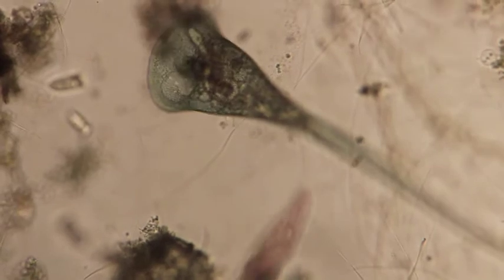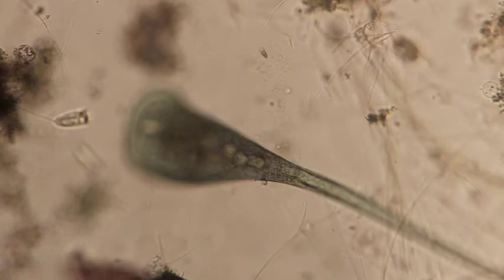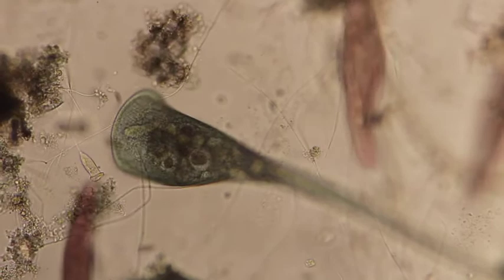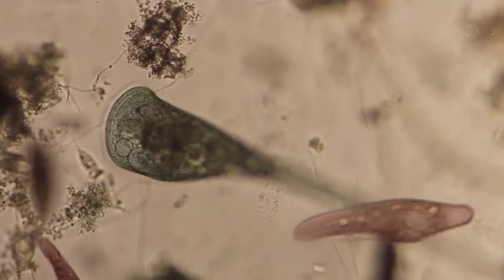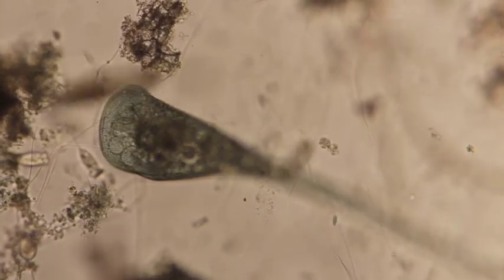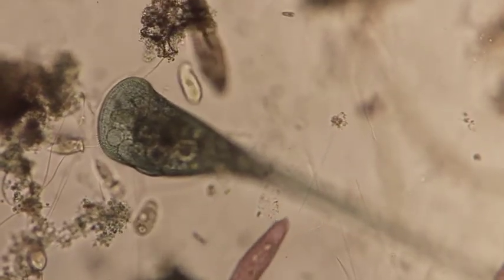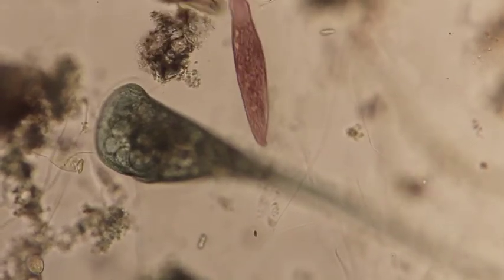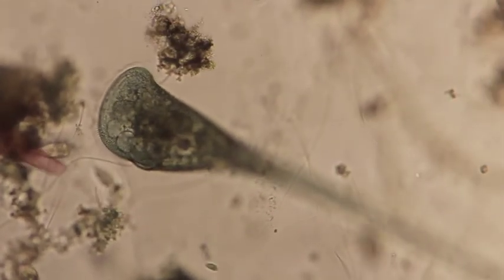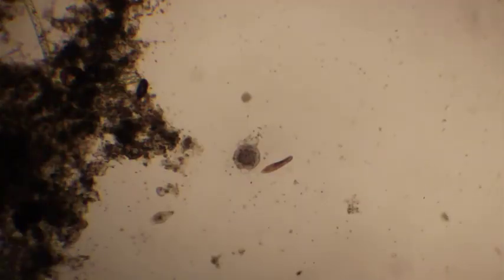But this guy is a stentor. He's a ciliate. You can see the cilia around its mouth. Okay, we'll just focus in. There's a Vorticella next to it that we looked at earlier. It basically is similar to a Vorticella, only a lot bigger and eats a lot bigger stuff. And we can see it here very well. You can see all that cilia around its mouth. Then the stentor will beat its cilia and filter feed.